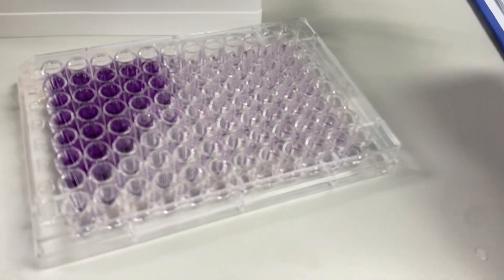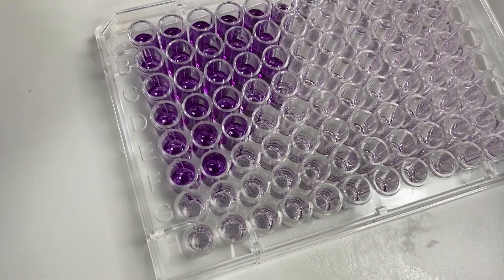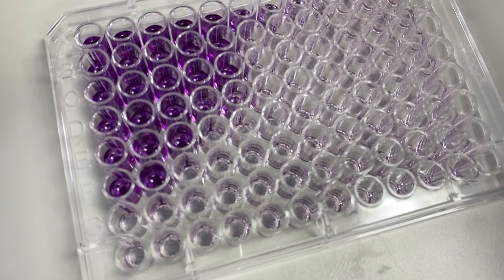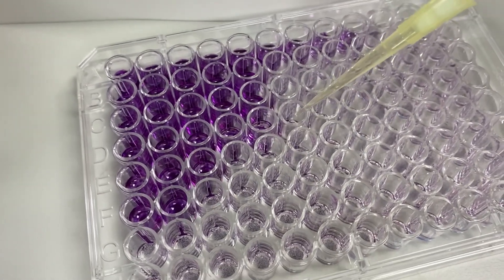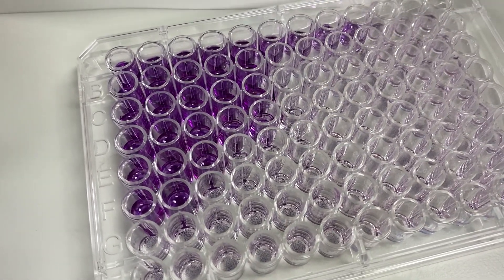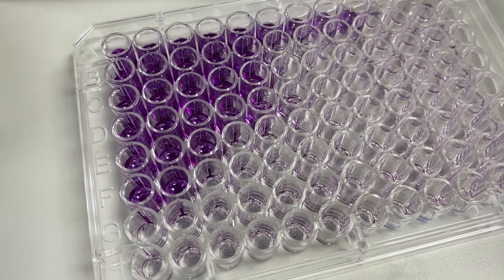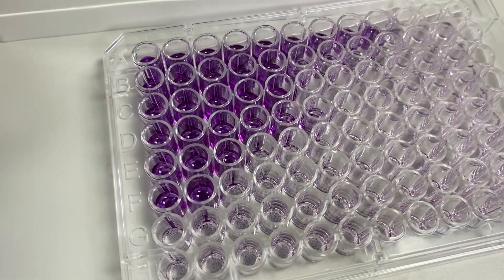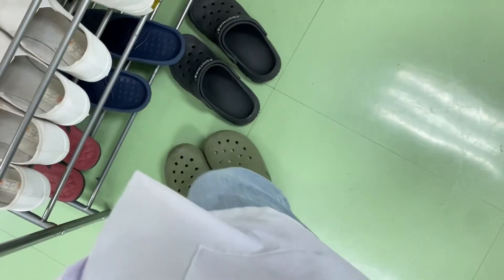The phenomenon behind this is that the MTT reagent, which is yellow to orange in color, is converted into formazan crystals which are purple, through an enzyme present in the mitochondria called mitochondrial reductase. That's the basic phenomenon behind this assay, and it is widely used in almost every in vitro research project because it is primarily used for cell viability.